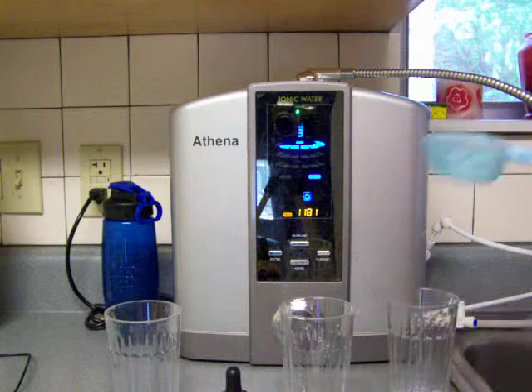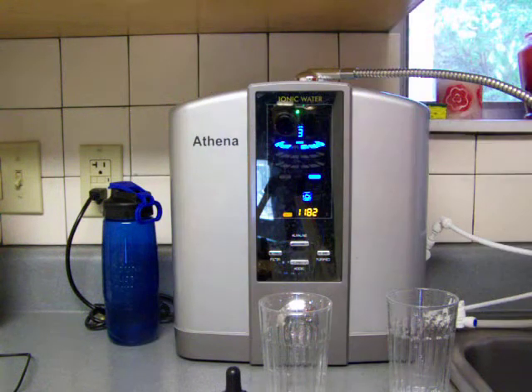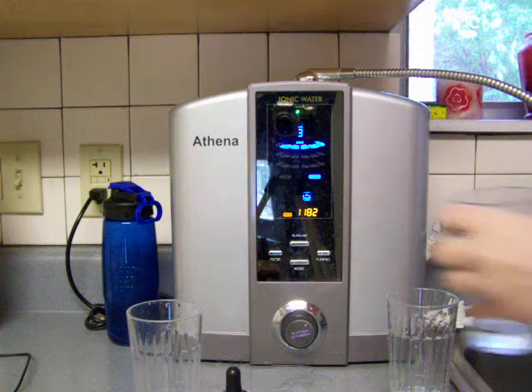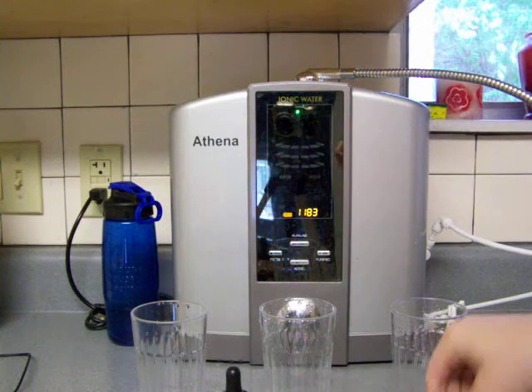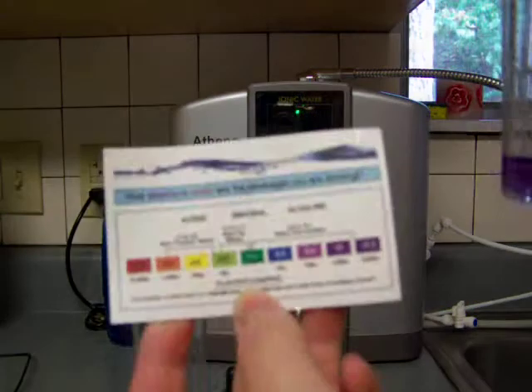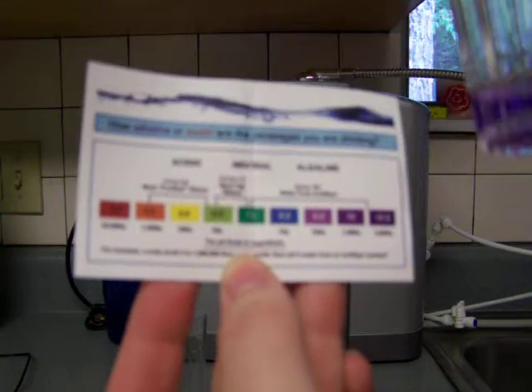I'm using this eighth of a cup measuring tool here so that we're close to the same amount. We're going to put three drops into this one and use our little color chart here. I'm going to say that it's about a 10.5.